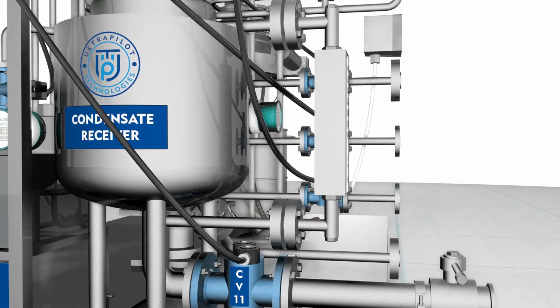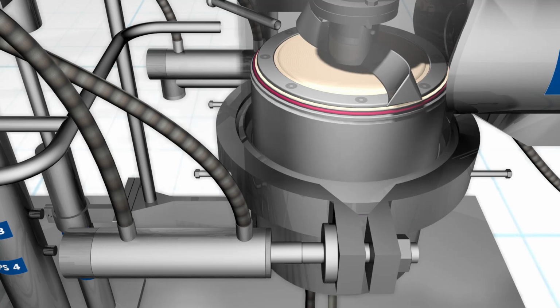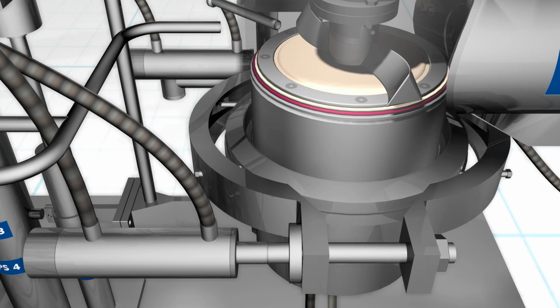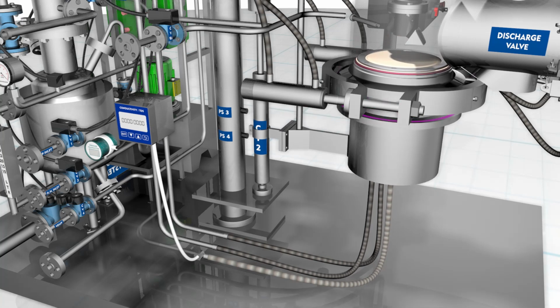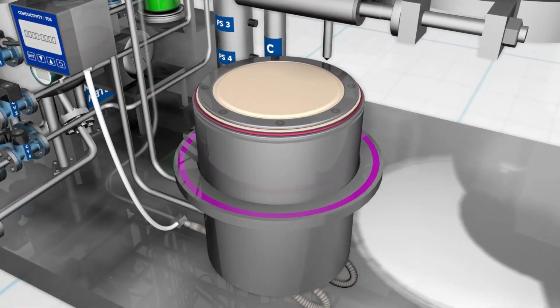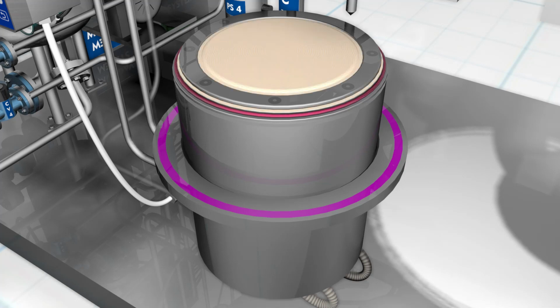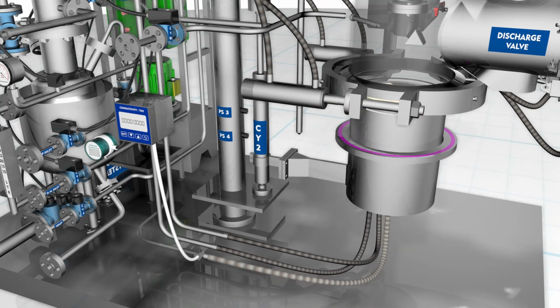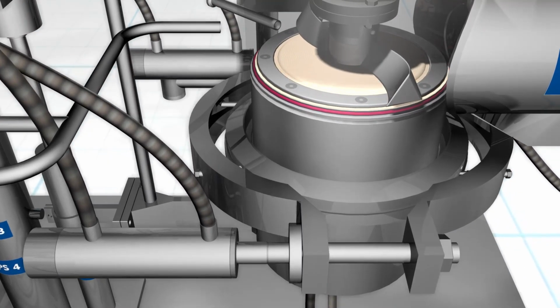For operating the bottom detachable arrangement for the ANFD, the bottom is lowered by operating the bottom detachment cycle, which opens the clamping cylinders CY4 A or B and then lowers the bottom by cylinder CY2. The proximity switch PS3 indicates the open position, and activation of proximity switch PS4 indicates fully opened condition. On bottom open position, motor M1 has to be disabled as a safety measure. After completing the cycle, the cylinders are again raised by activating the solenoid valve on the power pack. The proximity switch PS3 will indicate bottom closure.